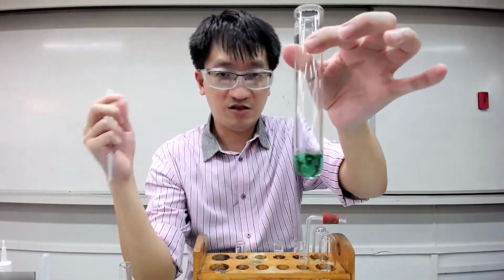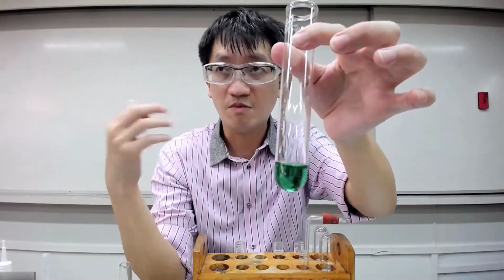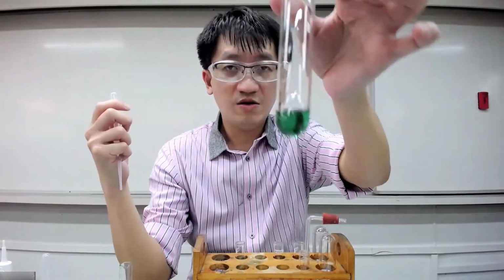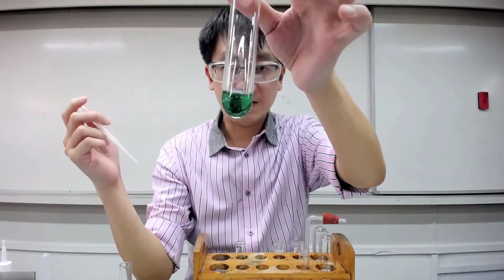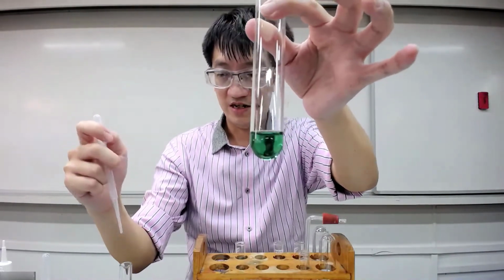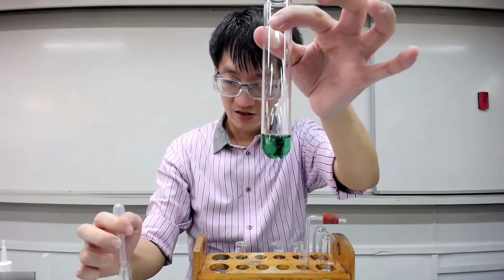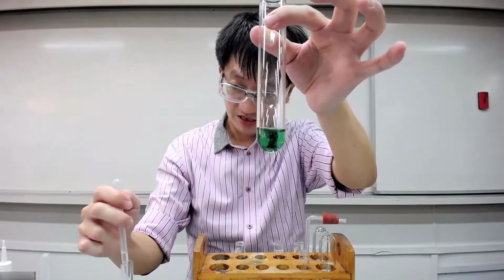Okay, I think I explained in the tutorials before, maybe during lab practice. So I'm going to do something called layering. Okay, so what exactly is layering? Okay, so what I'm going to do now is I'm just going to add in ammonia dropwise. Not exactly 1 cubic centimeter, but I'm going to add in dropwise.